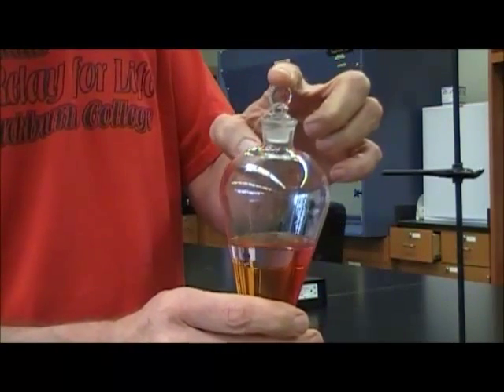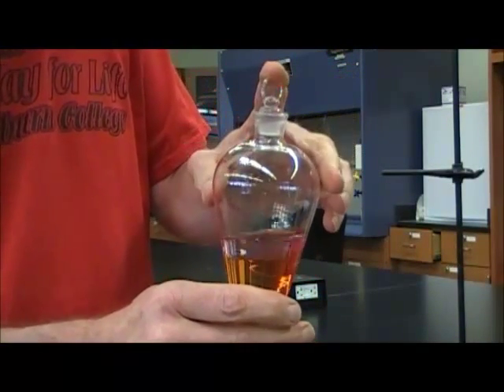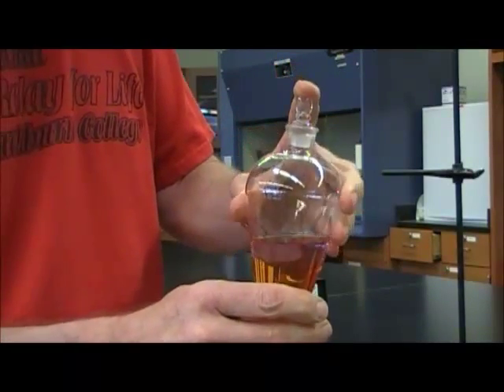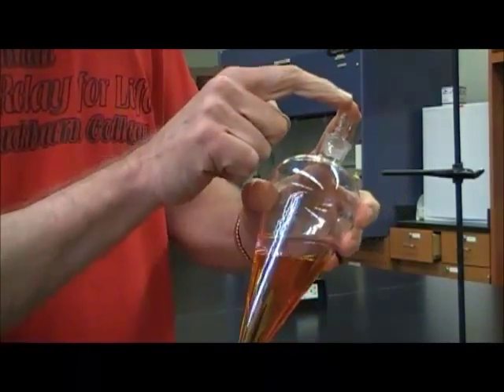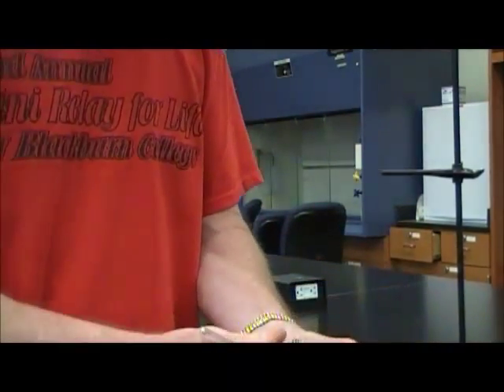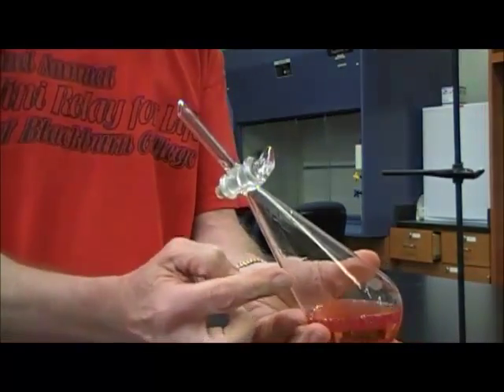I'm going to put my finger very securely on the stopper because what I'm going to do now is shake it, and it's very likely to build pressure inside. Stopcock closed, finger firmly on the stopper. I'm just going to shake it, not very vigorously first.